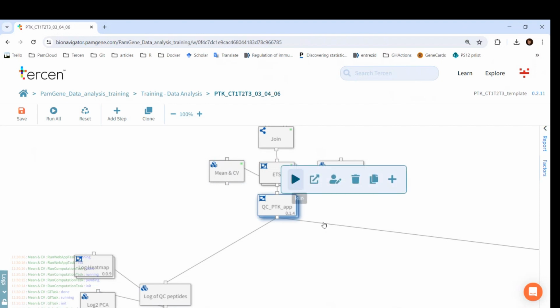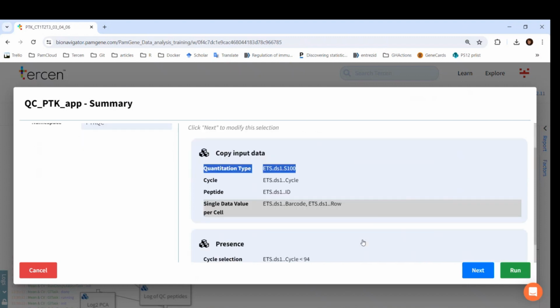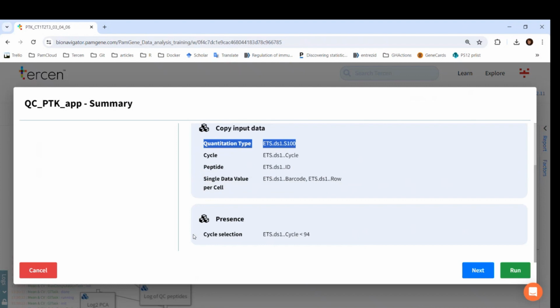Next, let's take a look at the PTK QC app. The aim of this step is to flag those peptides which are not present in the samples, so in the next step, we can filter them out. Let's run it. Again, in the wizard everything is filled out correctly as default, so we don't need to click through it. However, there is a special case when we do need to change the default cycle number here in this filter. The PTK QC app uses the information of which cycles are considered pre-wash.